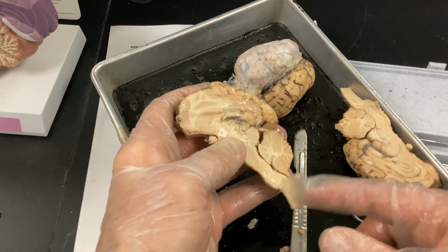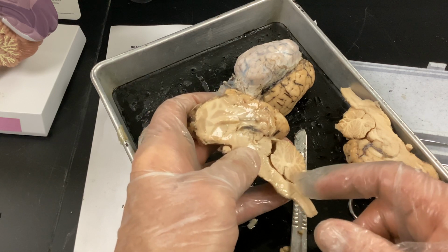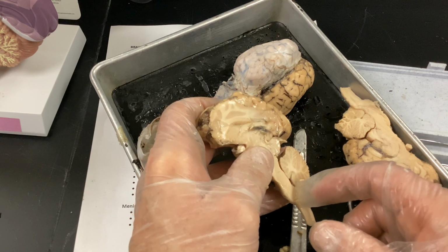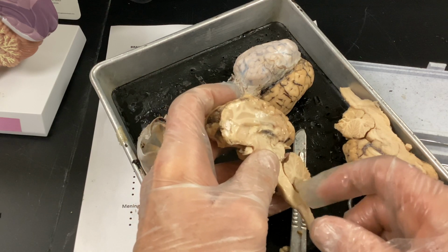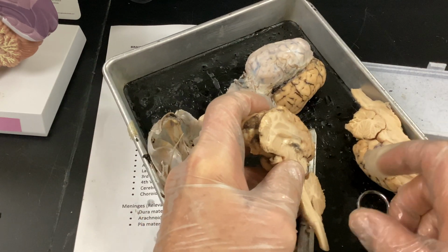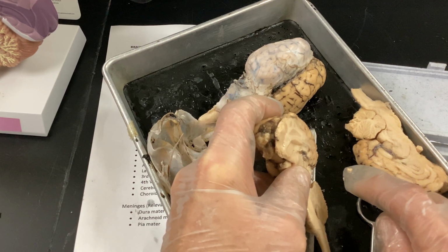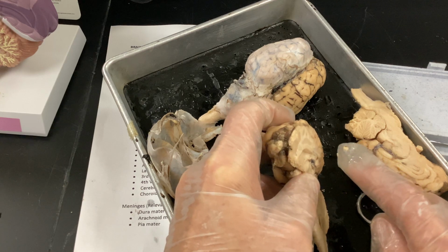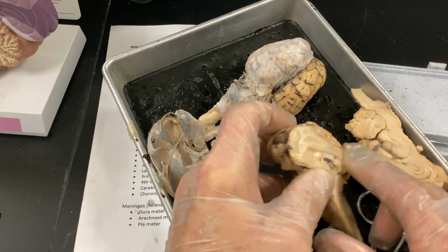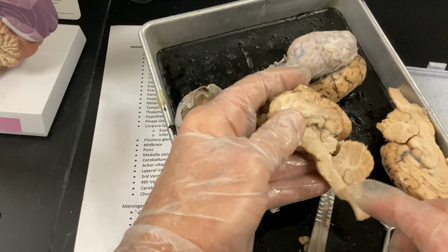There's your medulla oblongata, which is where the spinal cord and the brainstem come together. It's also, remember, where you have some respiratory centers, and if they ever ask you, it's where all of your nerves cross over, from right to left and then left to right. So we talked about the peripheral information from the right side of your body goes to the left side of your brain, and so forth. So the sensory or motor from the left controls the right, the right controls the left. We talked kind of about the homunculus.